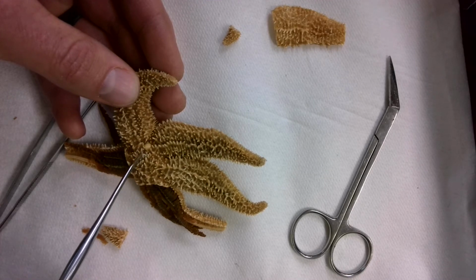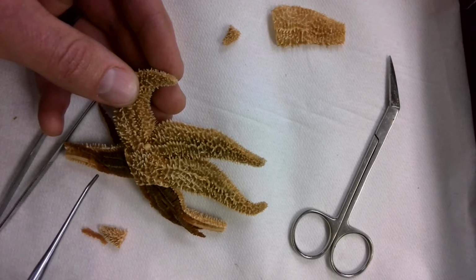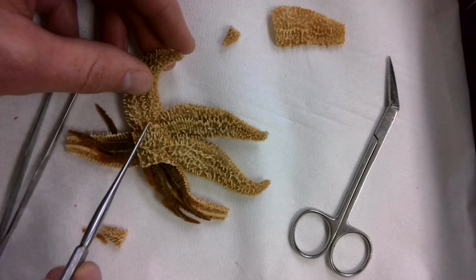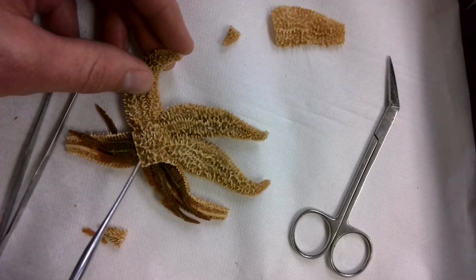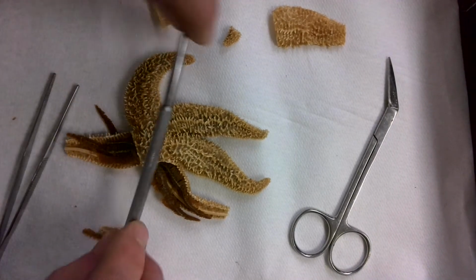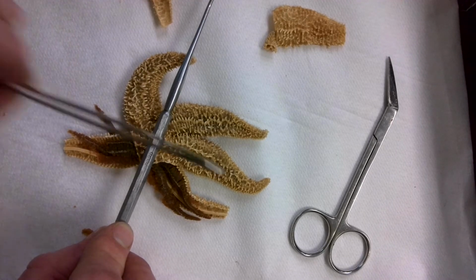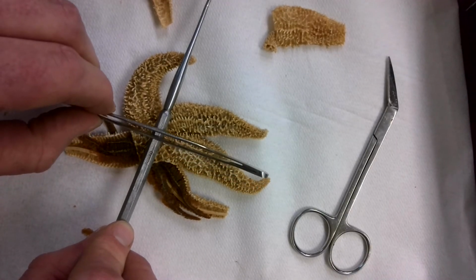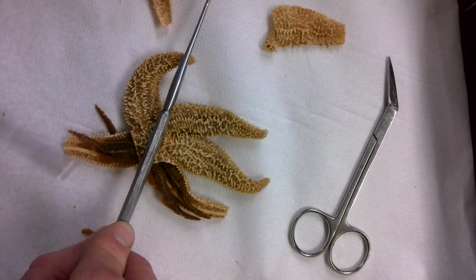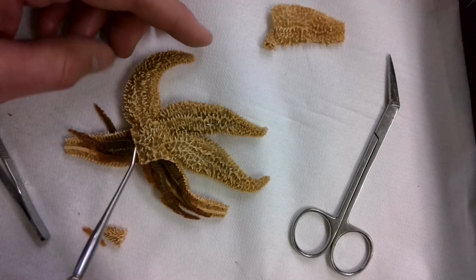When we talk about the water vascular system, right here, the madreporite, that is what brings in the water. Then you have this central disc, or this center region. It's called the central disc in a starfish. Remember, starfish can reproduce through regeneration. So if I cut the starfish down the middle like this, or if I cut it in 4 like this, each one of these pieces would then grow into a new starfish. So that is some of the external anatomy there.